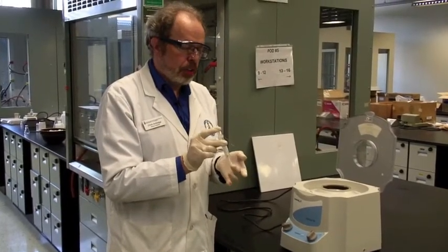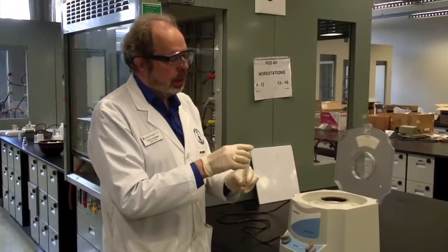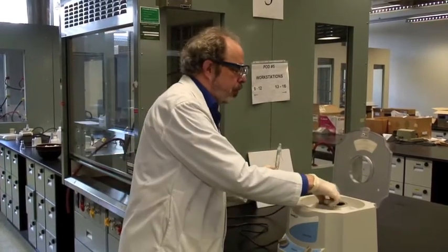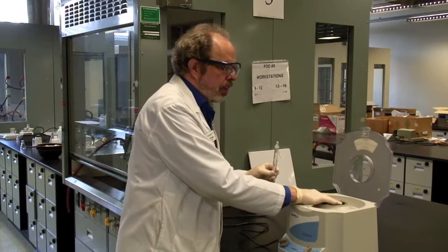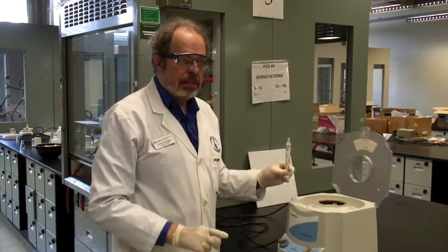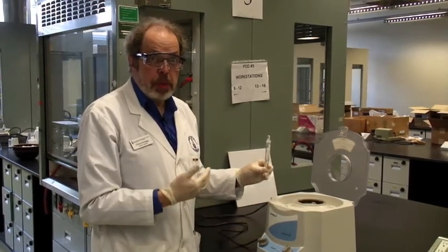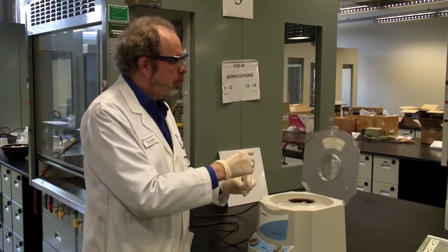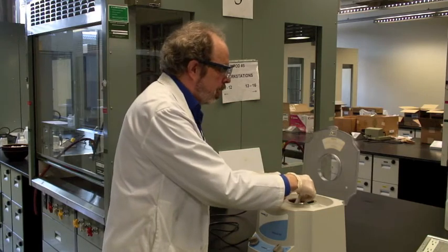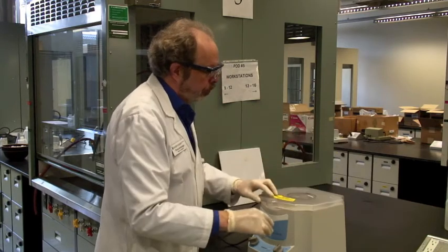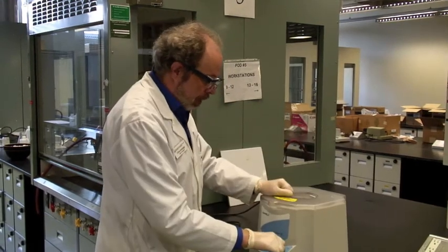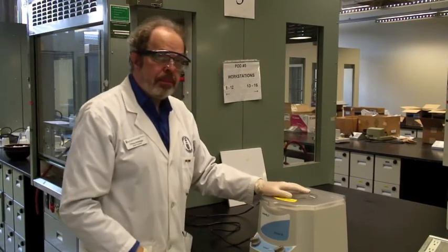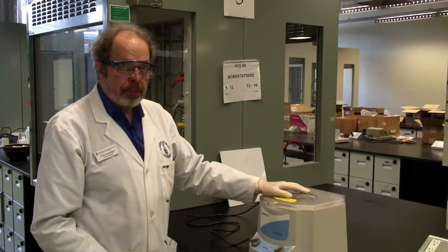Here we have our centrifuge tube and Craig tube assembly at the centrifuge. Now, we've got another centrifuge tube to balance this. You will undoubtedly have other people doing the same thing at the same time. So make sure you balance the centrifuge with these. Remember where you put it, and slide it in. And then turn it on to spin, and leave it for about a minute.